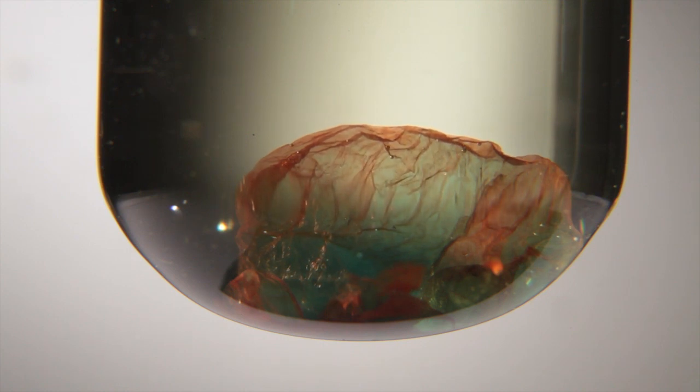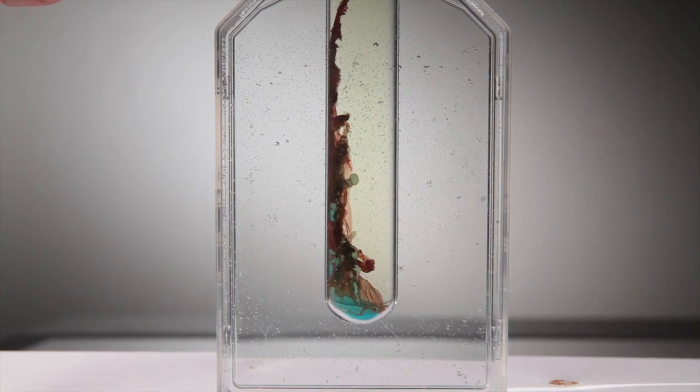Even if you botched the solution preparation, you can make some pretty cool chemical gardens.